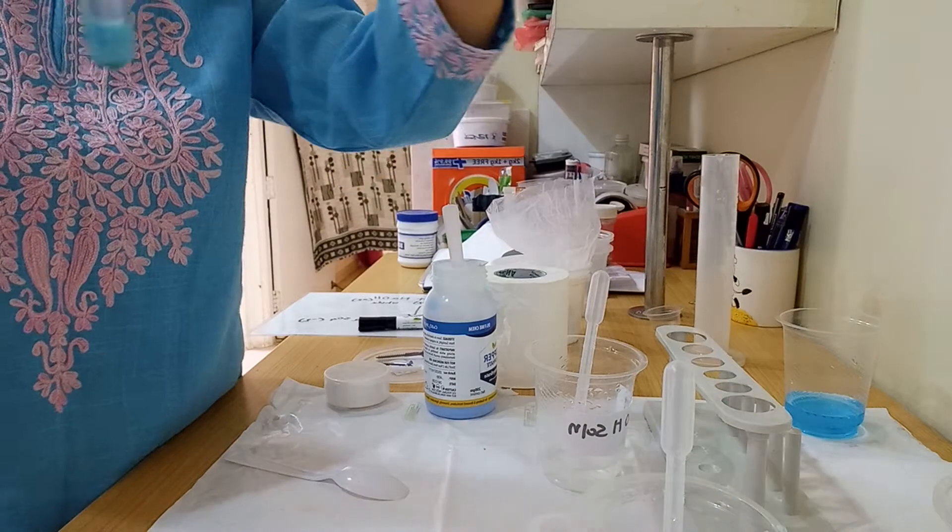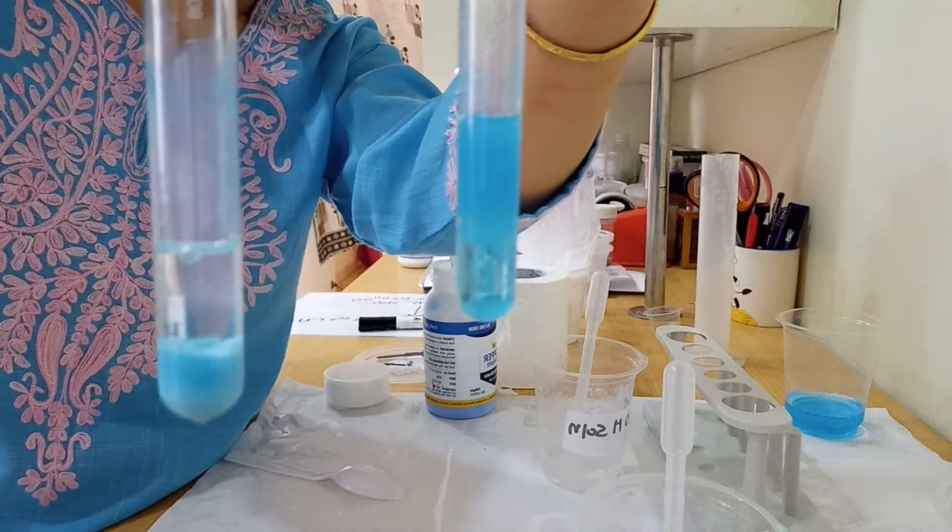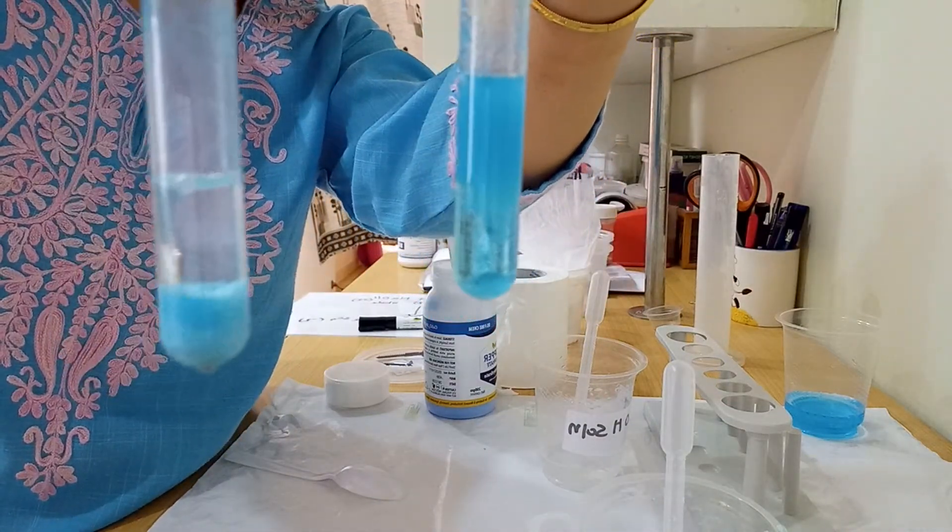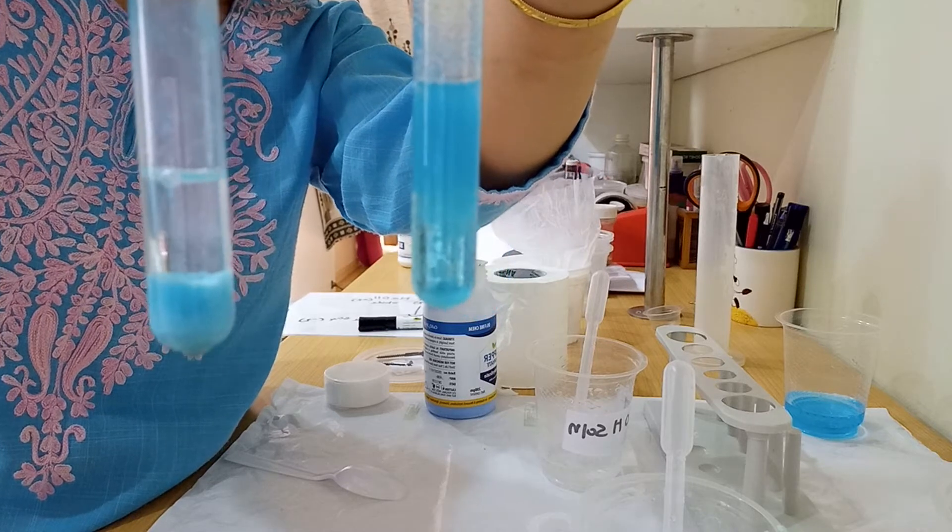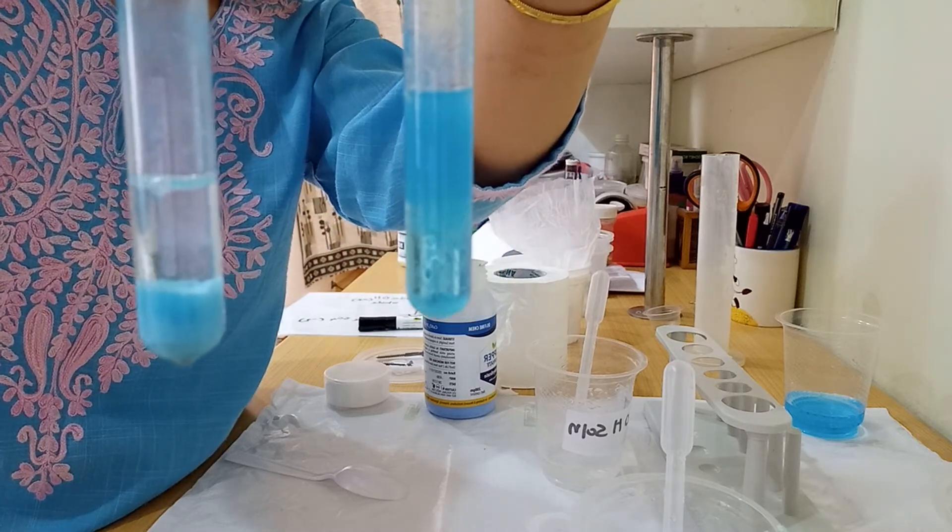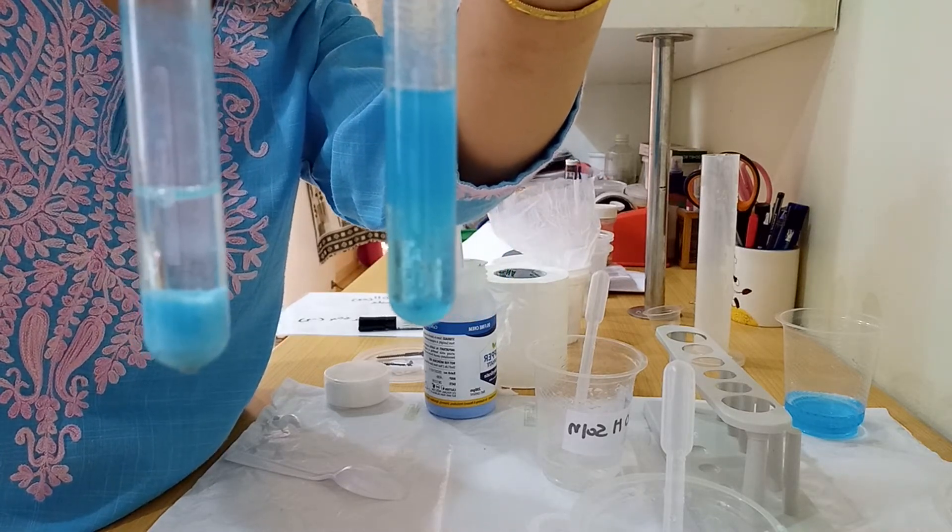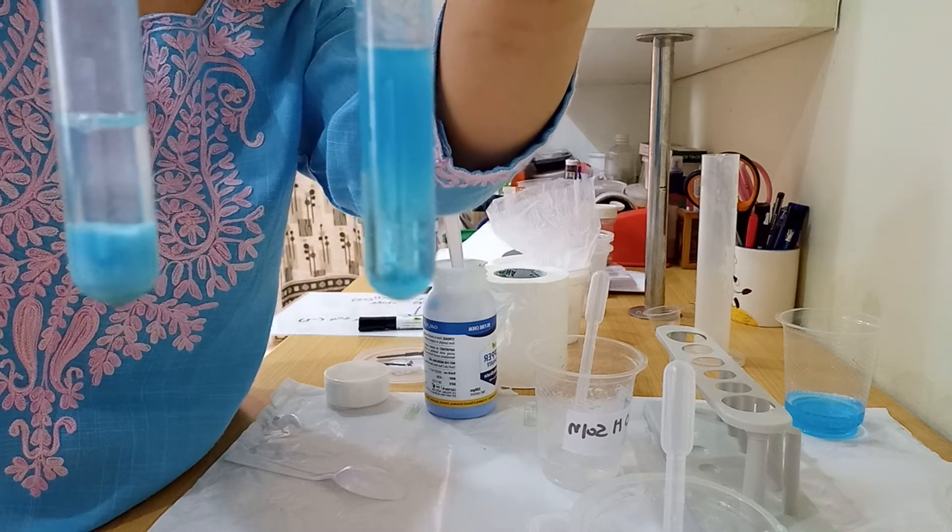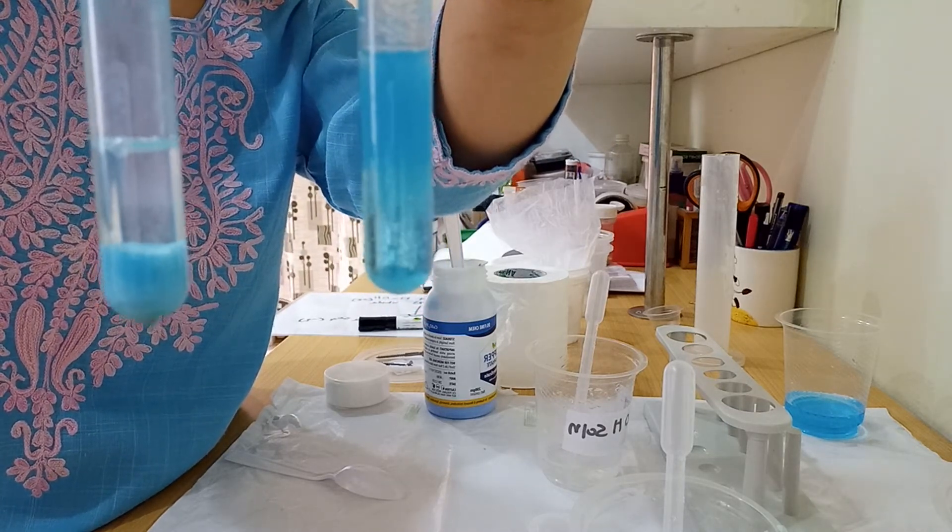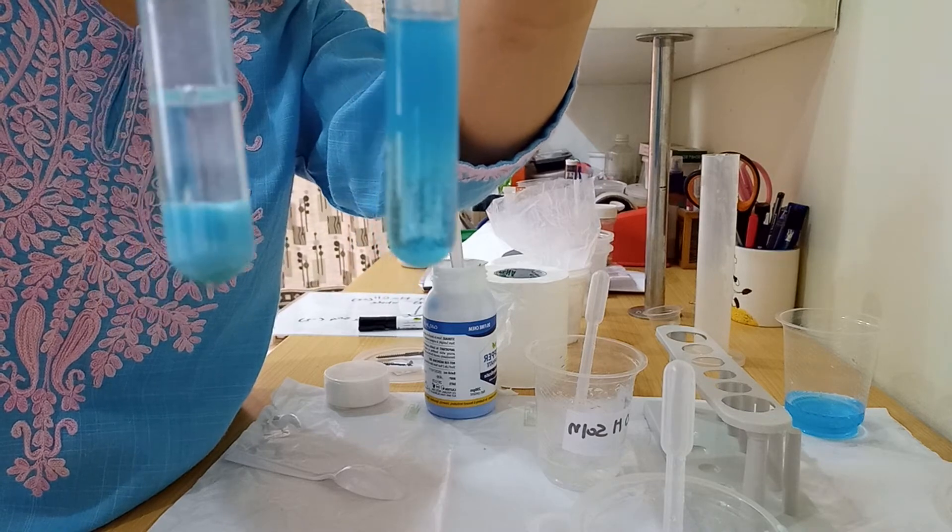I hope you enjoyed the reaction. You can perform this experiment at home or in your school chemistry lab. You can see an example of a double displacement reaction and observe how it looks.